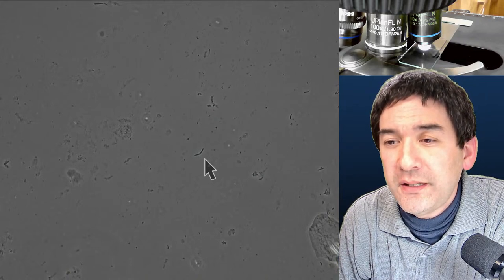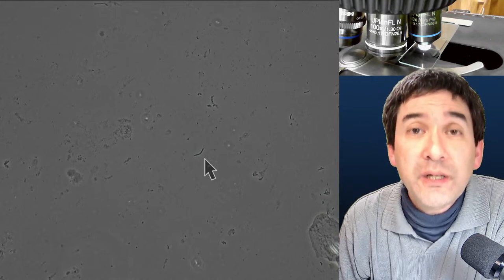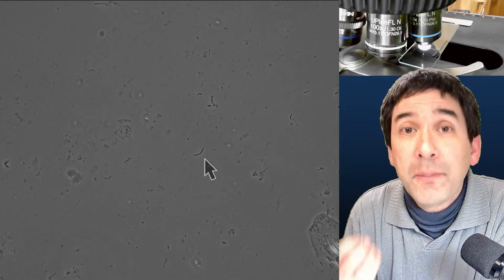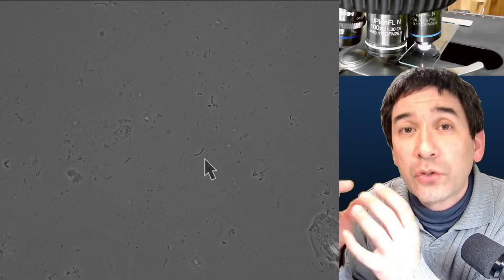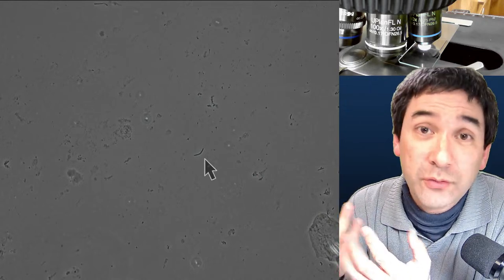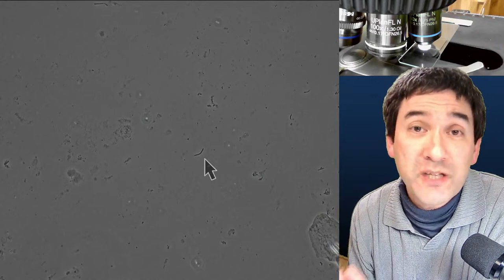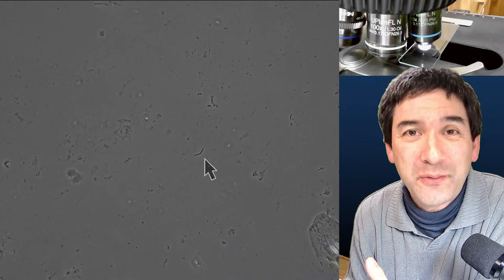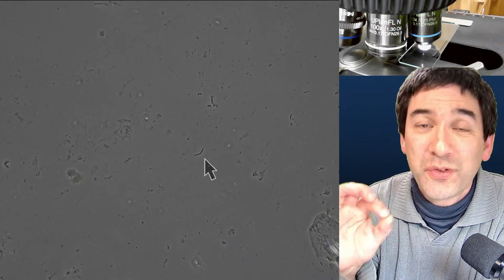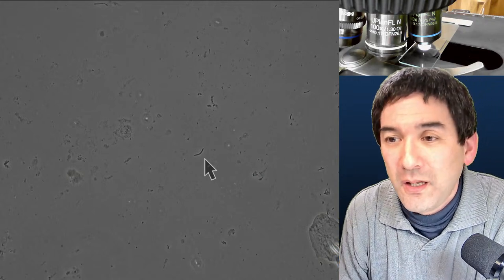Many bacteria do have a color — some are pigmented — but you don't see the color unless they're growing in a colony. It's like red blood cells: the blood looks red collectively, but under the microscope individual cells appear quite transparent. Similarly, even pigmented bacteria are so small and thin that their color doesn't come through under the microscope.